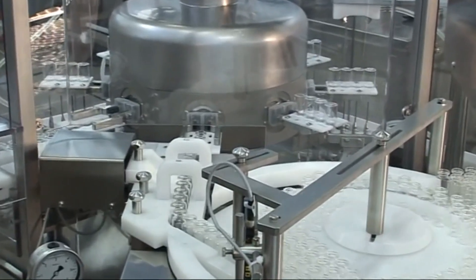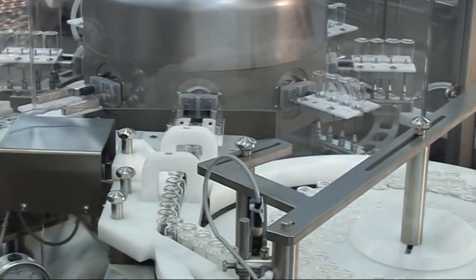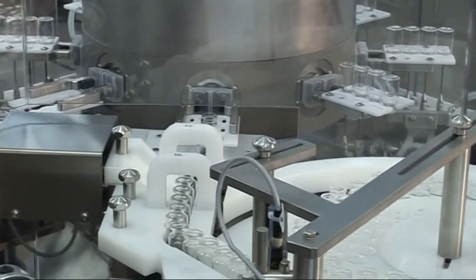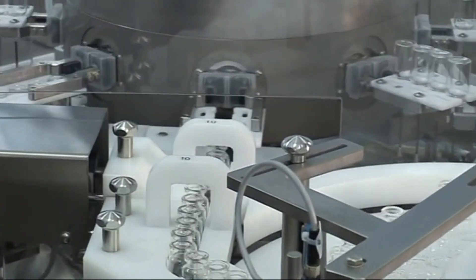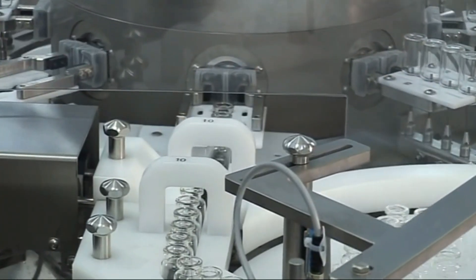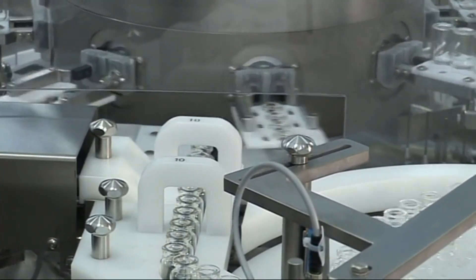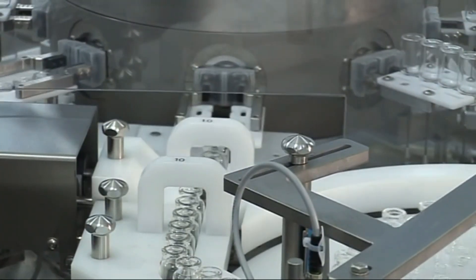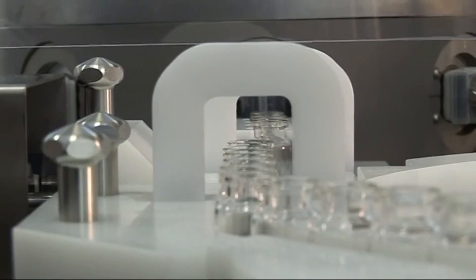Decontamination: Decontamination is done using manual or automated cleaning and sanitization, typically through the use of sprays and surface wipe downs. Decontamination times are usually shorter compared to isolators.